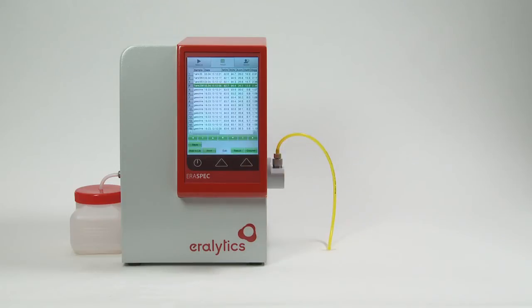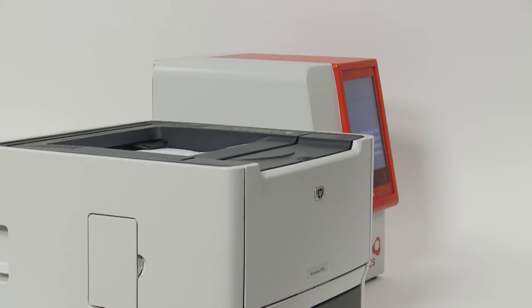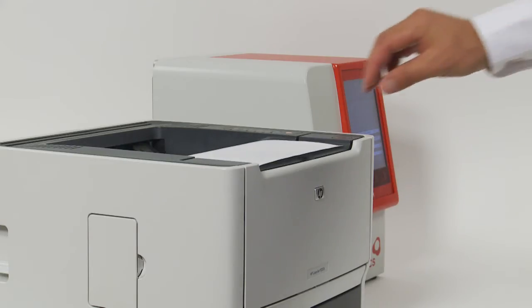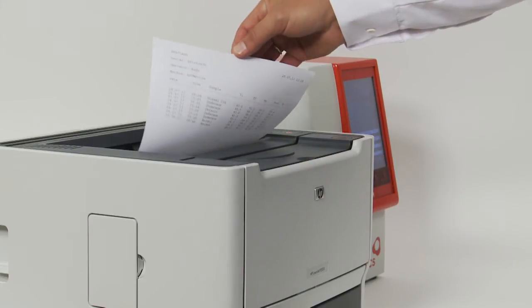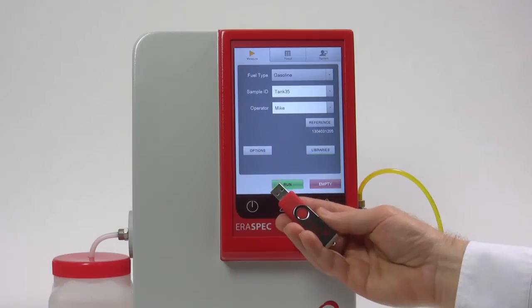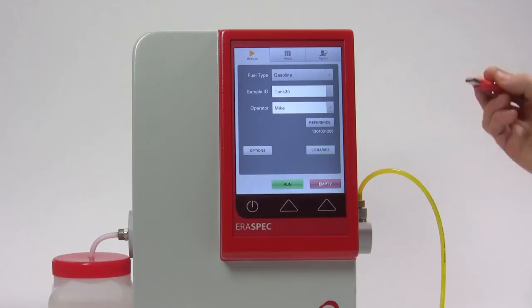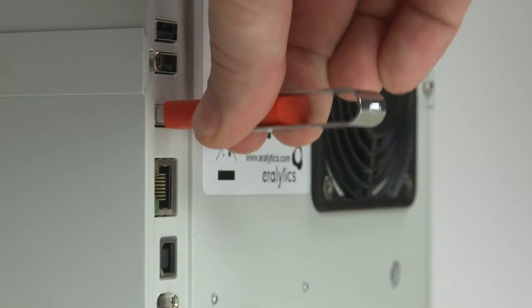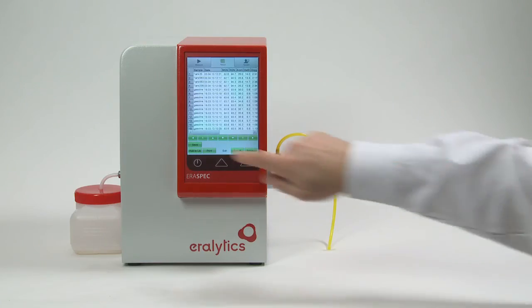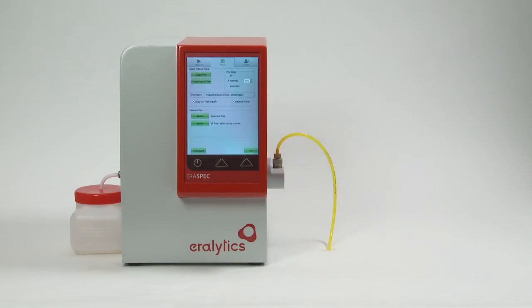The data can also be printed on a directly connected printer or via ethernet connection to a LAN or network printer. A file containing all results can be stored on a USB flash drive for storage on a PC or review in MS Excel.